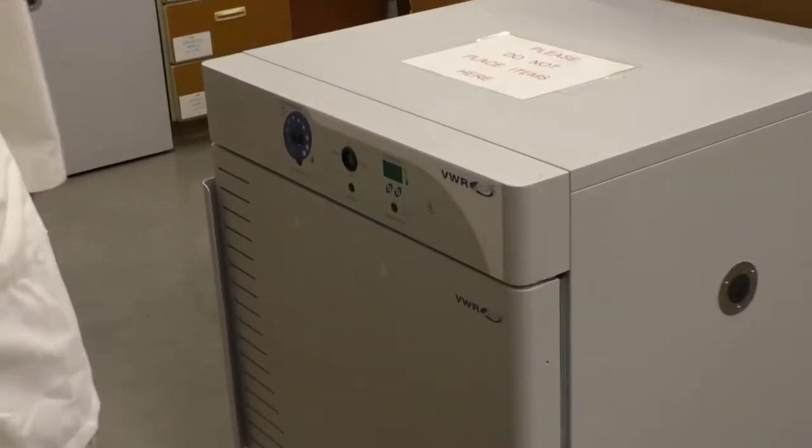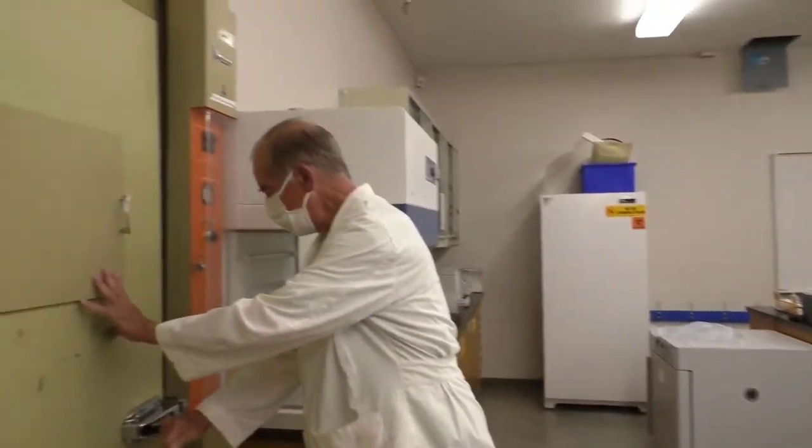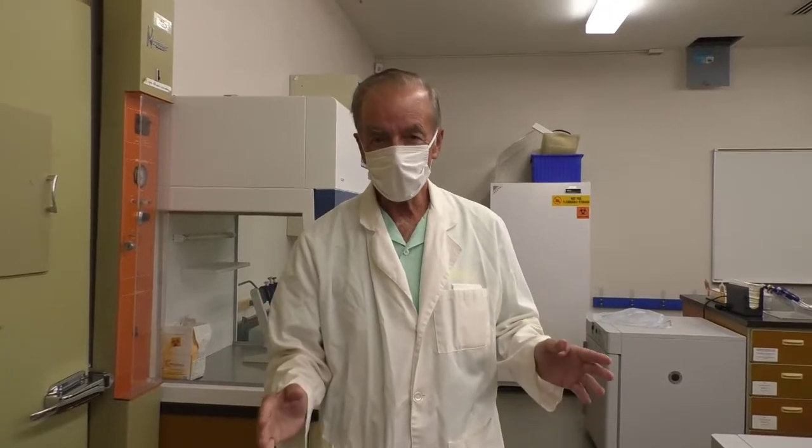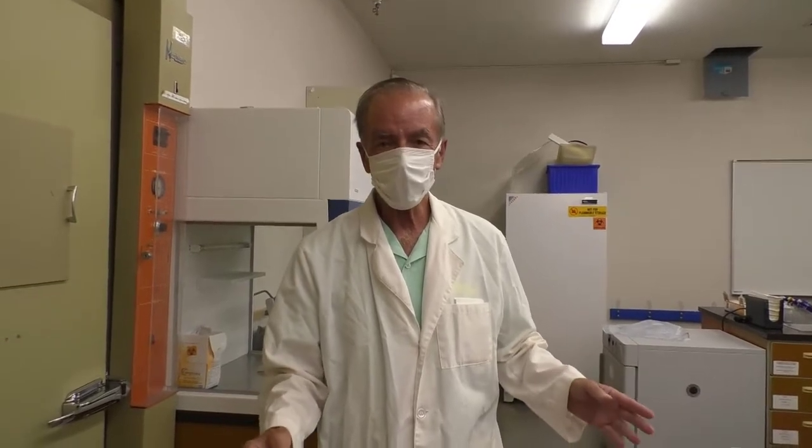Most of the time in the laboratory we'll be incubating our organisms in the walk-in incubator. In your case, for your take-home kit, you won't have a walk-in incubator at home, and I suspect that the top of your refrigerator will be one of the warmest and best places for you to incubate your organisms. We'll talk more about that later.